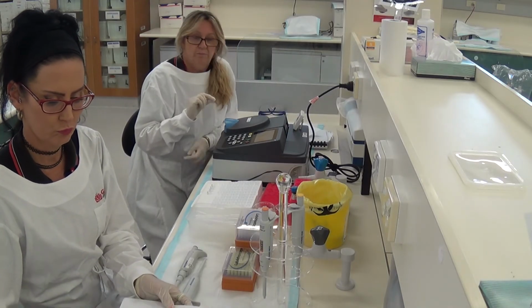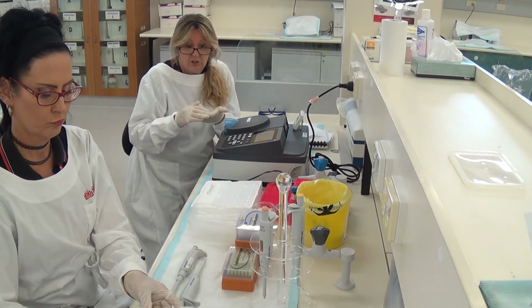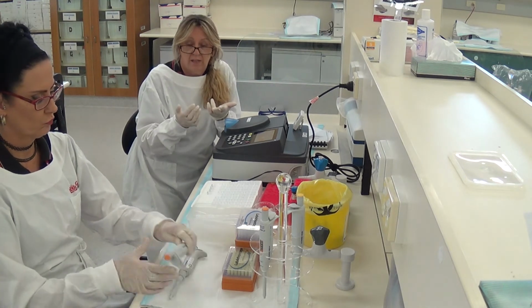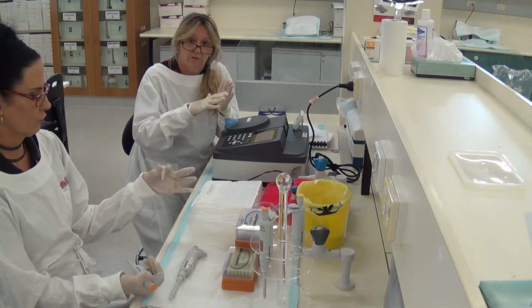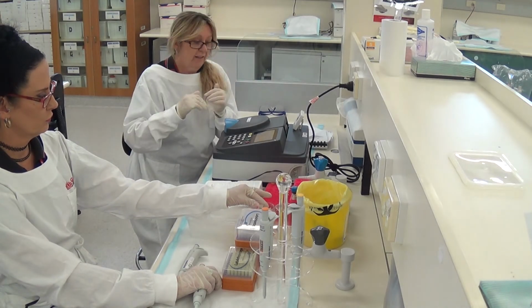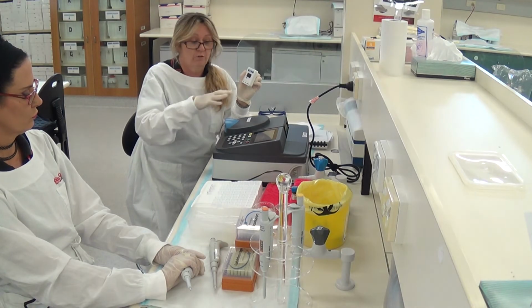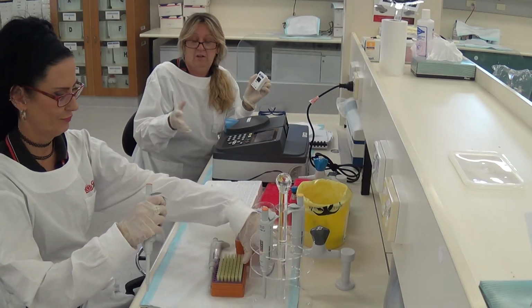I want you to understand what time 0 means. We have our NAD plus in there, which is what we're going to monitor our reaction with, and we have our 1 molar ethanol, which is our substrate. But nothing is going to happen until we put in the enzyme, the ADH, because the alcohol and the NAD by themselves do nothing. So that's going to give us our nice starting point. Now the important thing is we're going to add the enzyme, the ADH, and at exactly the same time that Kat adds it, I'm going to press the start button on the timer. Our time 0 is going to remain time 0 until such time as we add the enzyme.